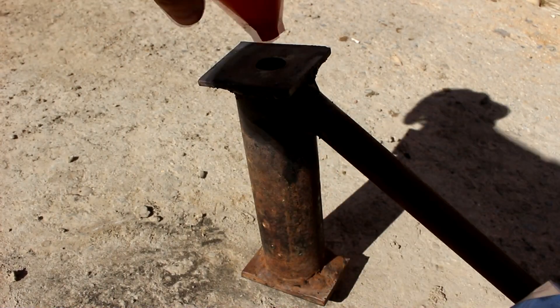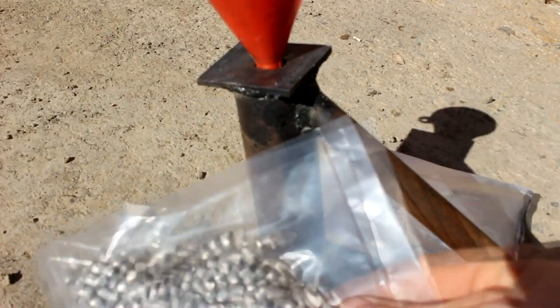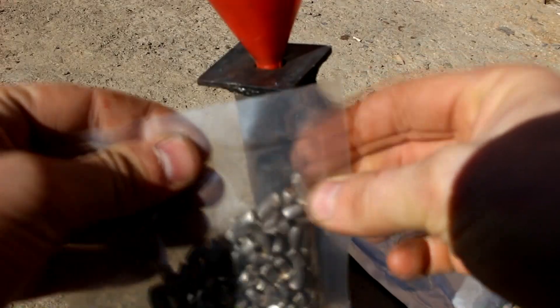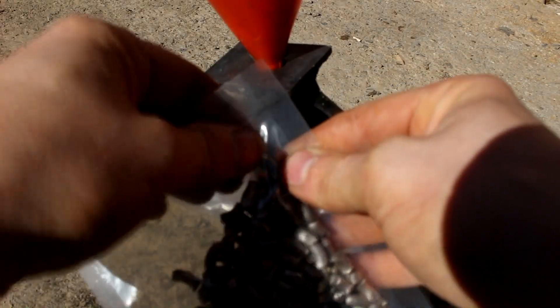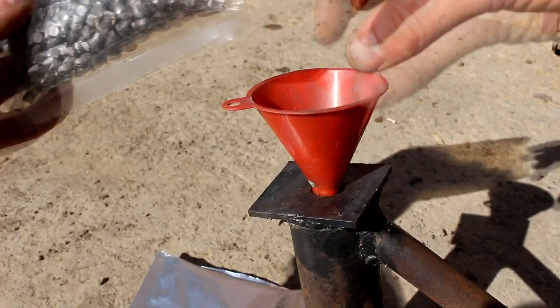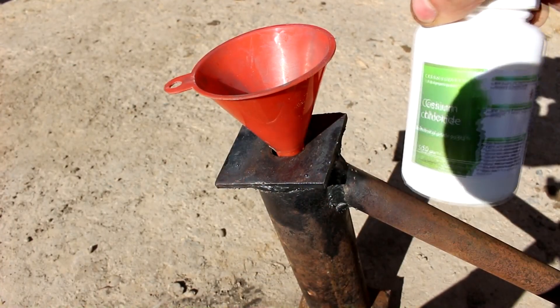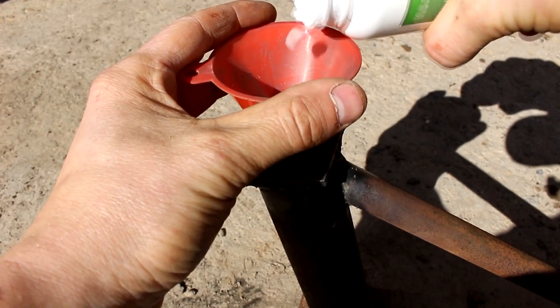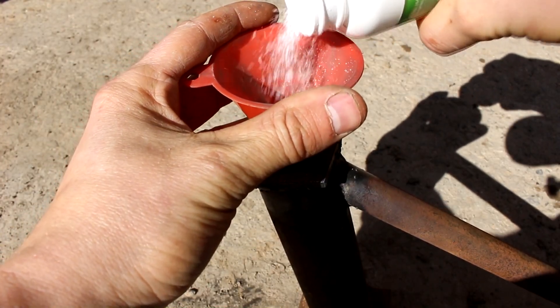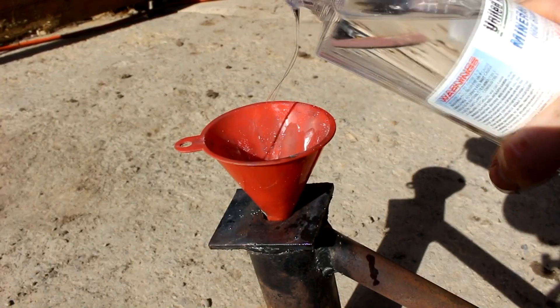To this I'm going to add some lithium — I think about 10 to 15 grams of lithium. That's enough to reduce nearly 200 grams of cesium, so this will be a little bit excess. Now I'm following the lithium up with some cesium chloride — I'm going to add about 250 grams. And to finish, a tiny bit of mineral oil just to displace the oxygen.